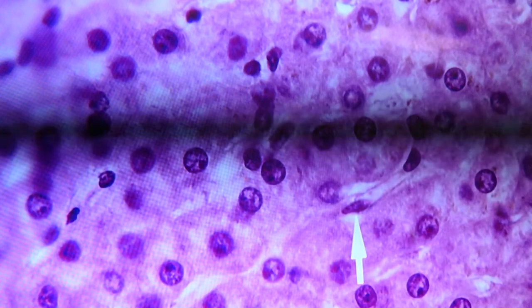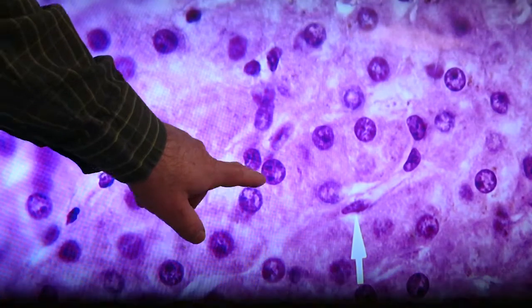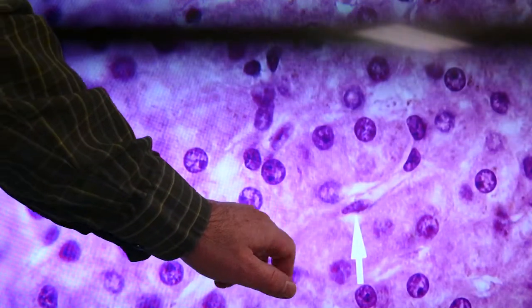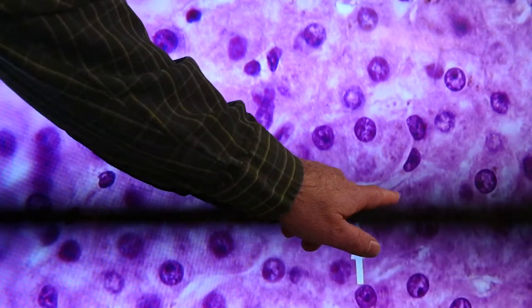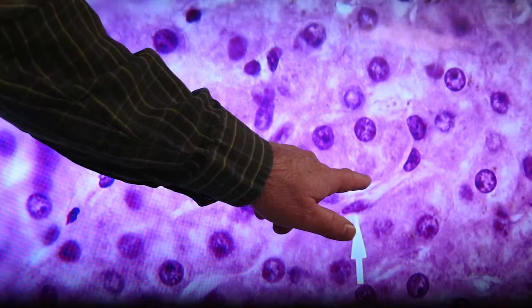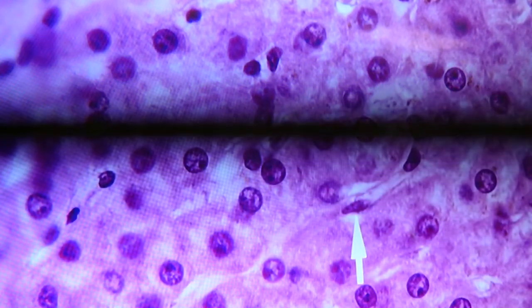Here the arrow points to an endothelial cell nucleus, a flattened nucleus. You can see the hepatocyte nuclei are nice and round. That space right through there would be the sinusoid space, and you can see a nice straight line. Straight line comes up to the nucleus of the endothelium right here. So anything between that straight line there and the hepatocyte would be space of Disse, again, outside of the endothelium.